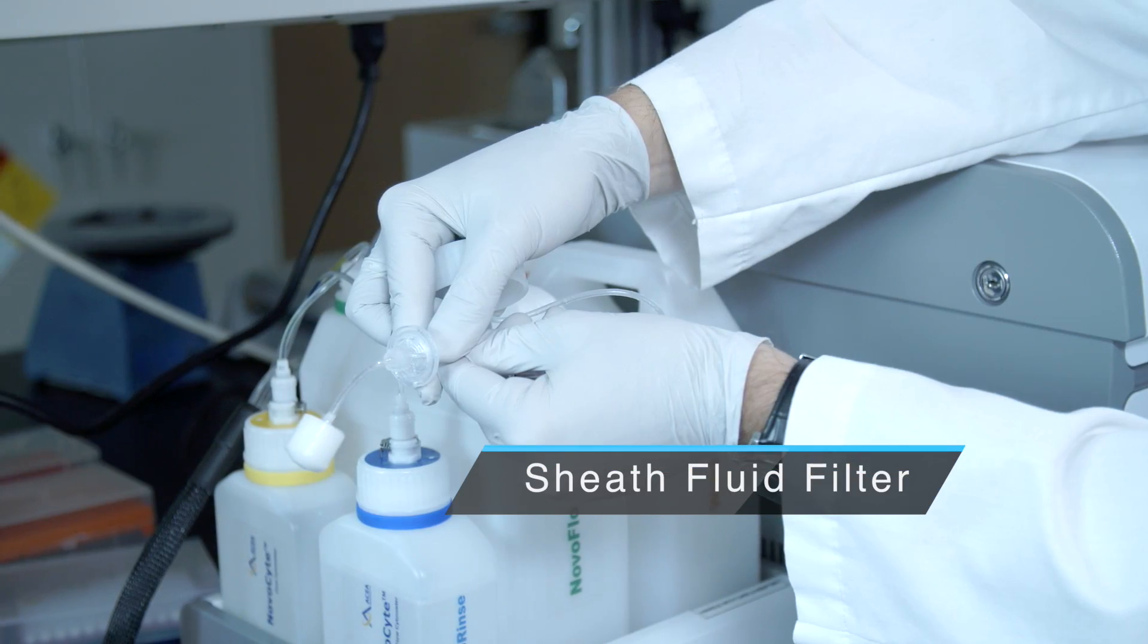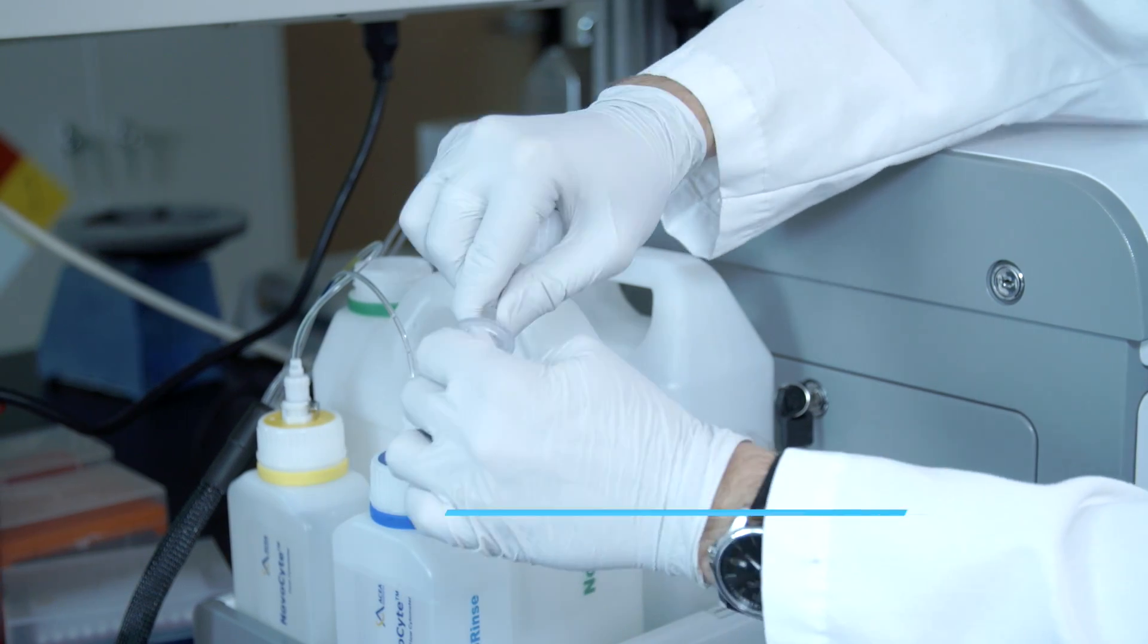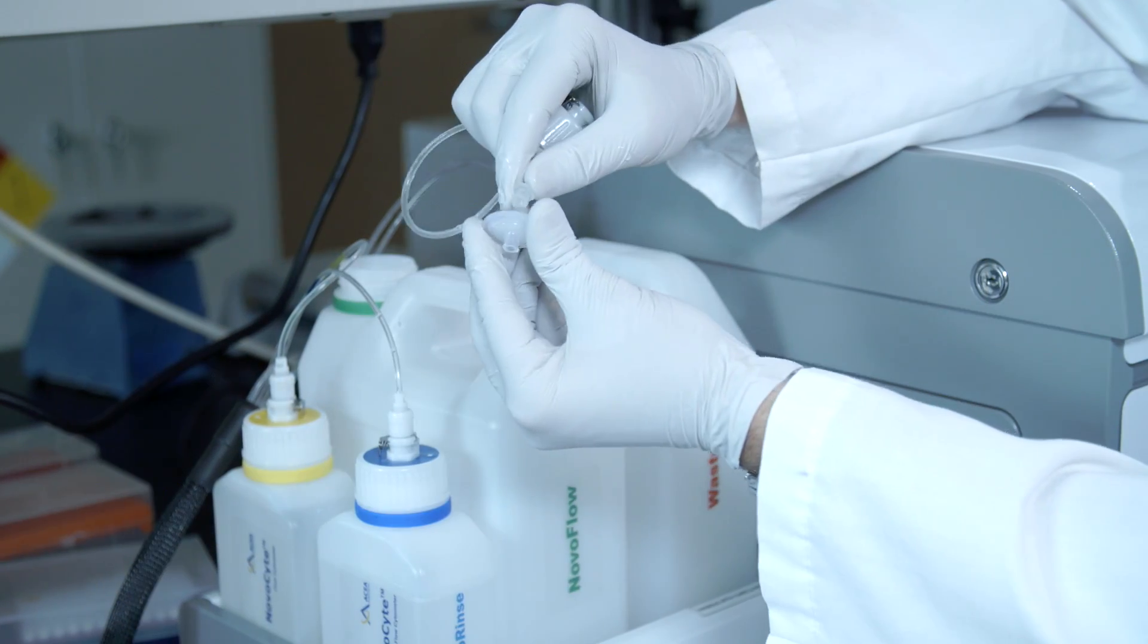The sheath fluid filter requires you to detach the tubing and attach it back together with a new filter.